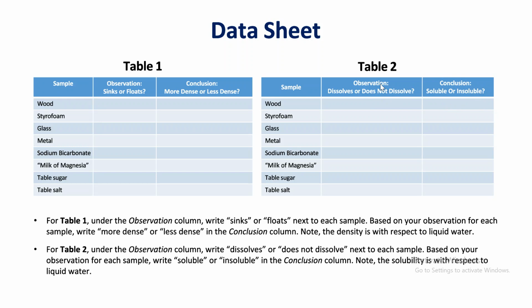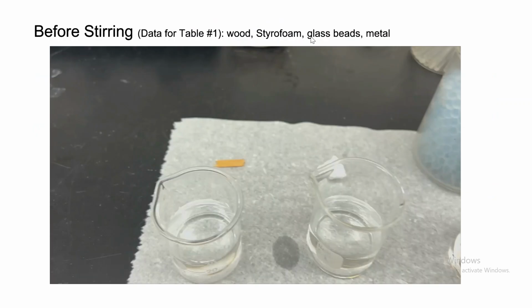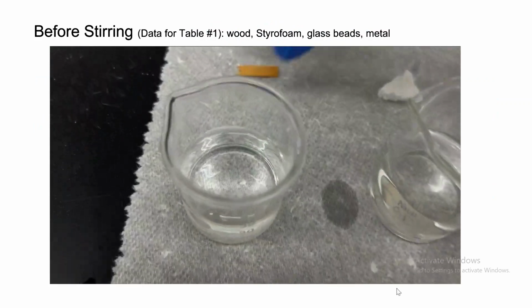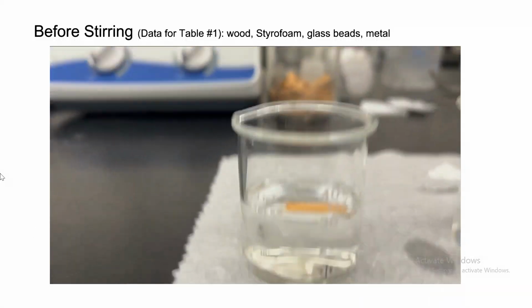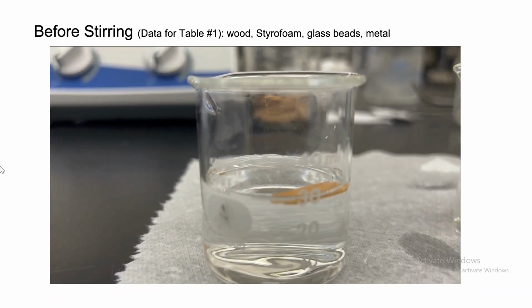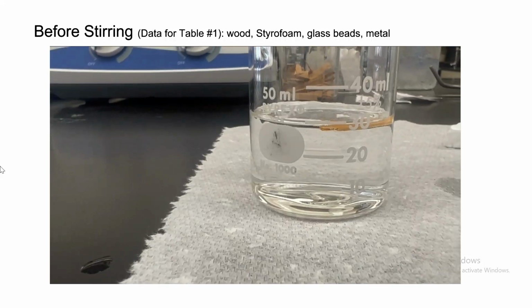So now let's start the experiment with some videos. The first video is for wood, styrofoam, glass beads, and metal. So let's start. We're dropping some wood in some water. And as you can see, is it sinking or is it floating? It looks like it's floating.